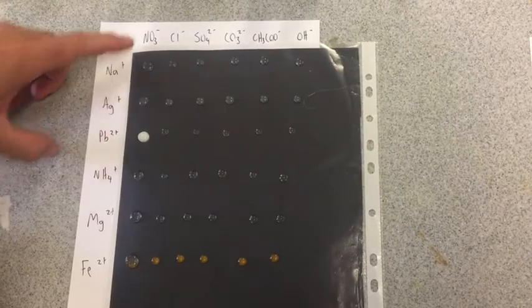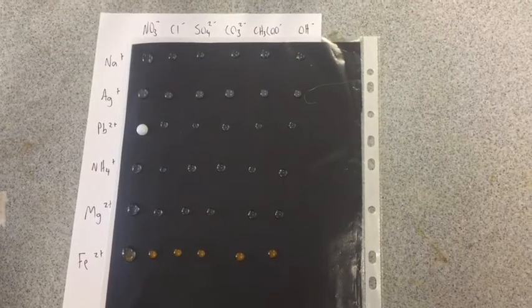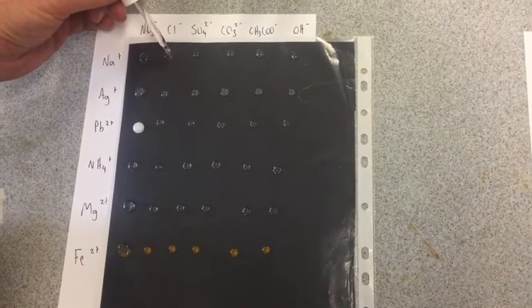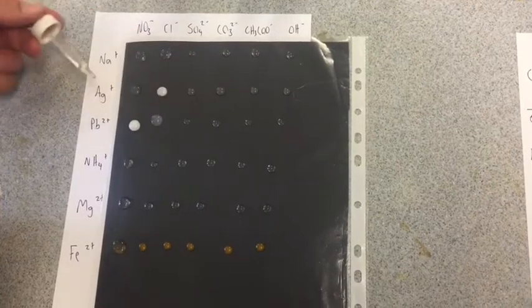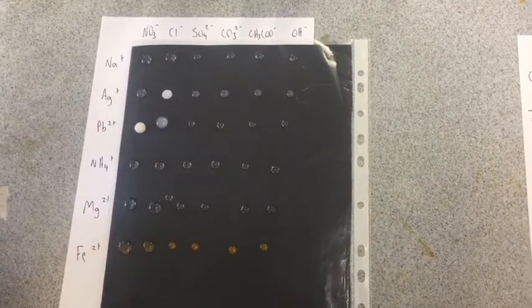Okay, so we've got lead nitrate has given us a precipitate, so that can maybe help us figure out some rules. I can tell you right now that nitrates aren't meant to precipitate with anything. Next, we're trying chlorides with those 6 metals, and we've got silver chloride. There's a faint colour there for lead chloride, and on we go for some of the others.